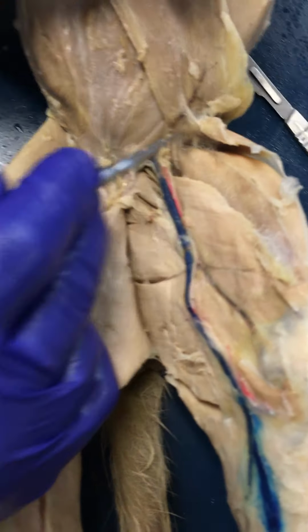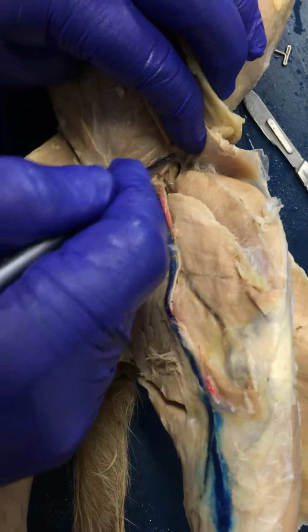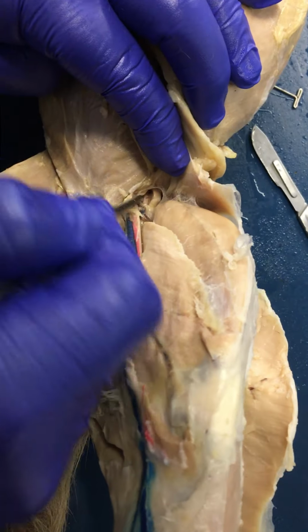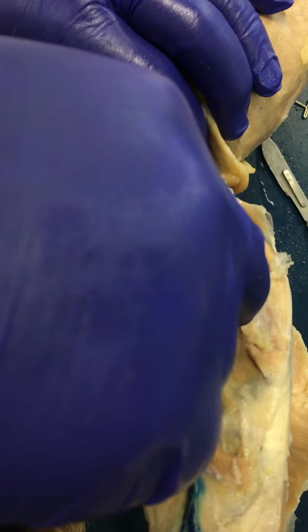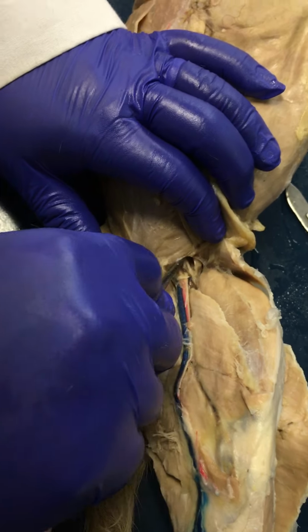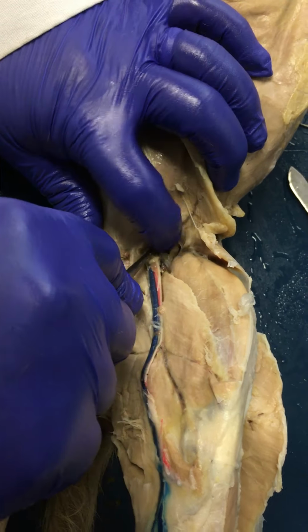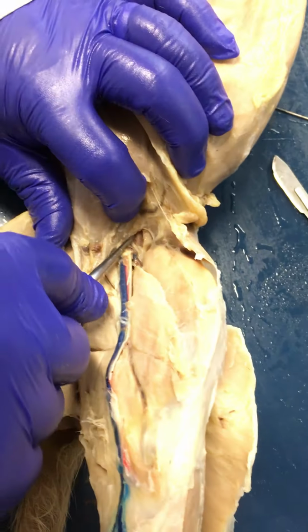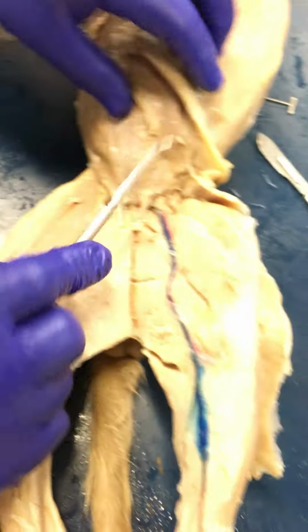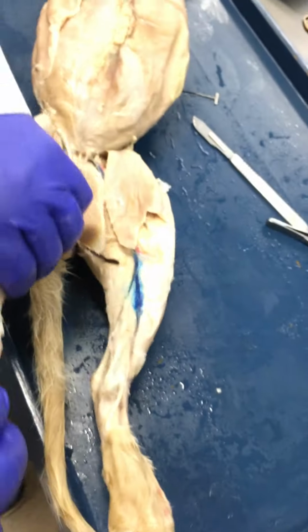Finally, the last muscle to consider here is going to be a fairly deep muscle that will be just lateral to these blood vessels, and that's going to be your iliopsoas. Right, so there's a branch of the femoral nerve there. If you look deep there, you see that muscle. Right? That is your iliopsoas, and this guy is going to be involved in flexing the thigh at the hip as well. So that's that guy.